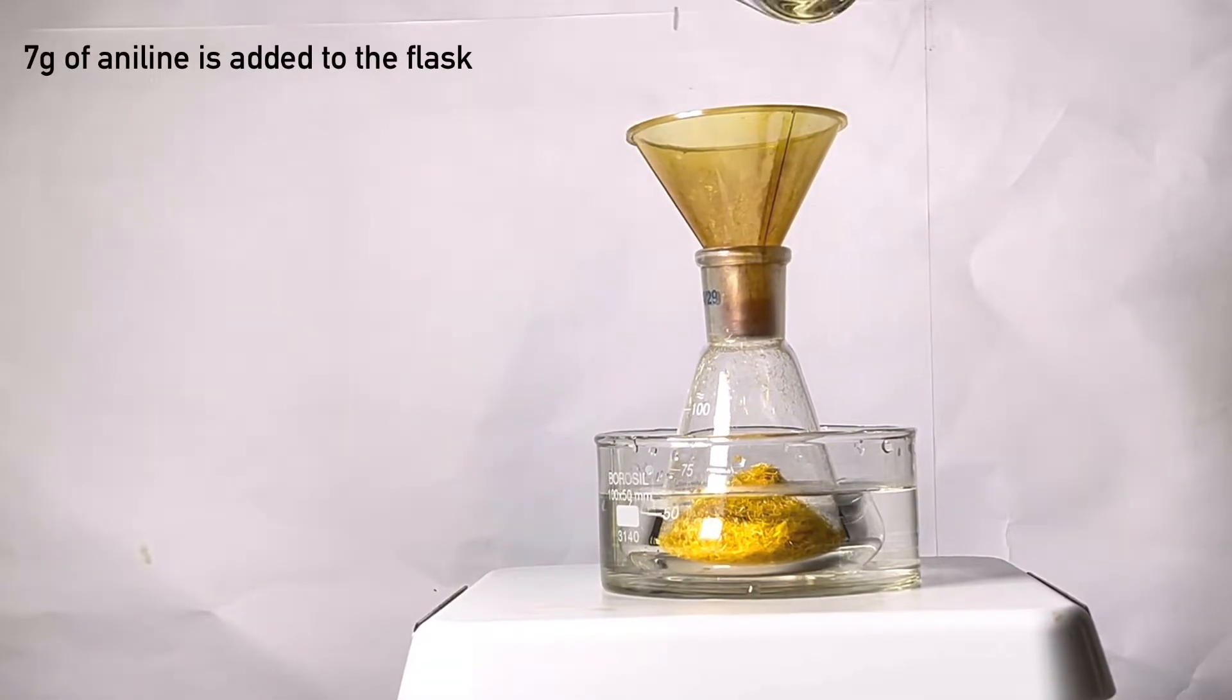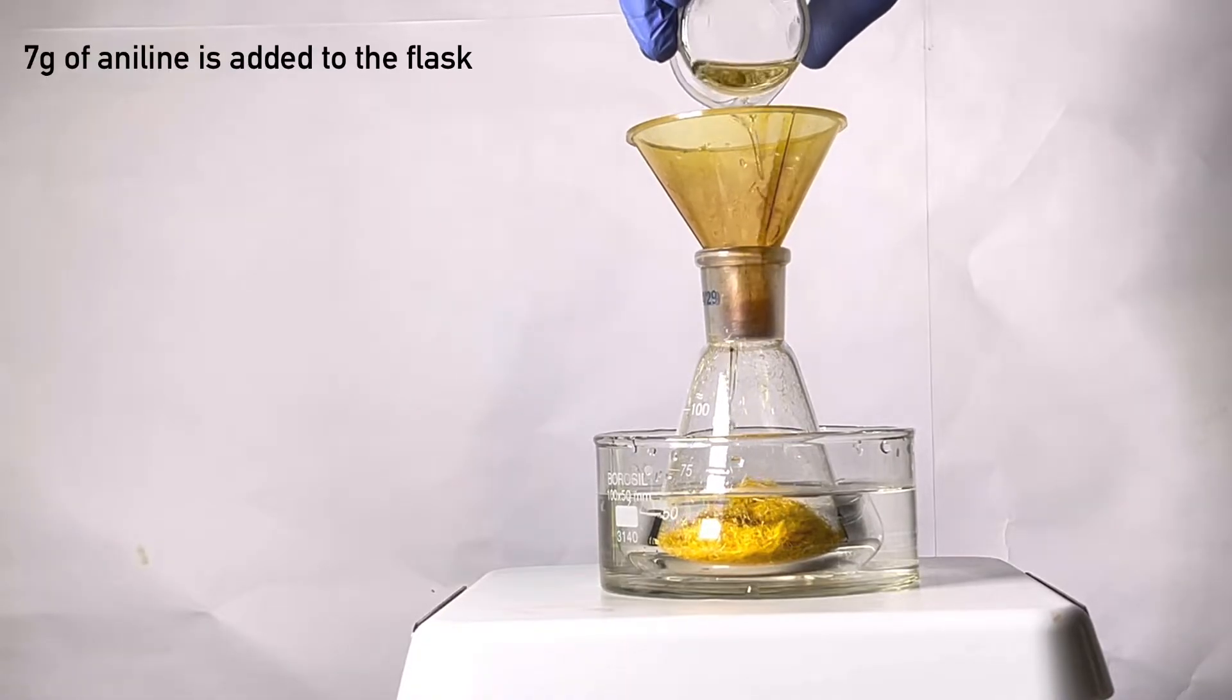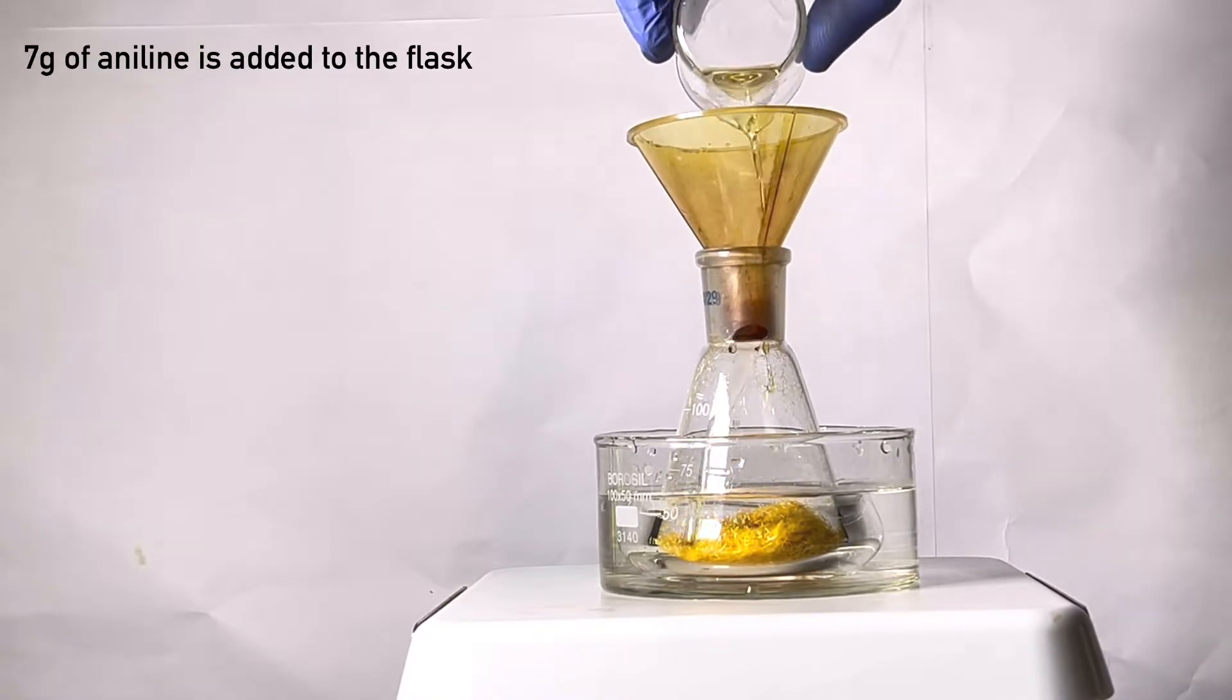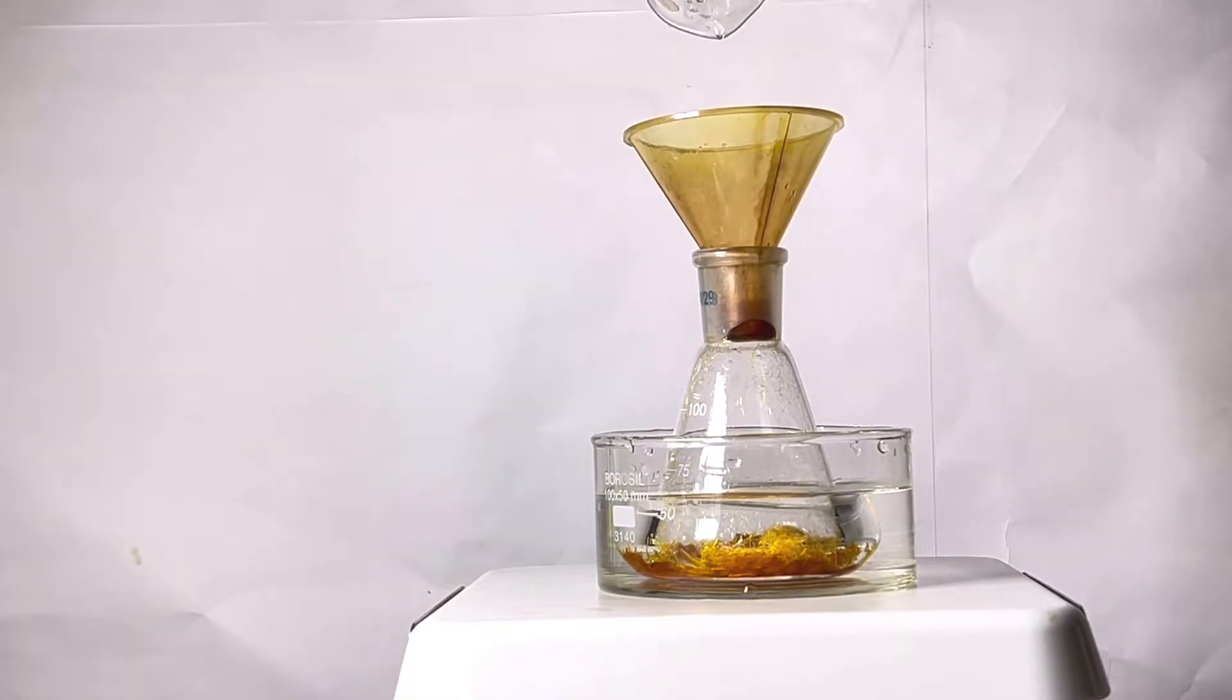Once it is all in, 7 grams of freshly distilled aniline was transferred to the flask. As you can see very clearly, all those fluffy crystals very quickly disappear as they dissolve in aniline.